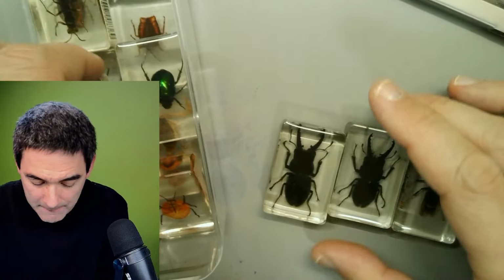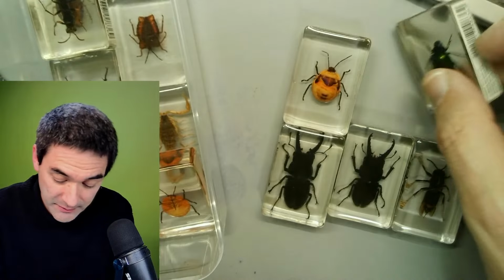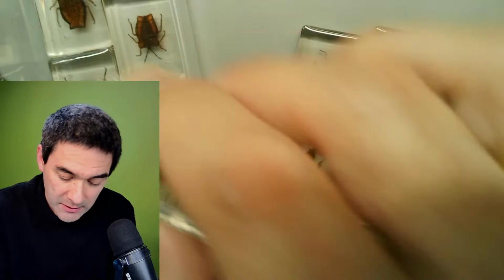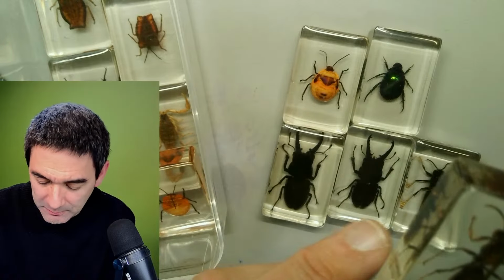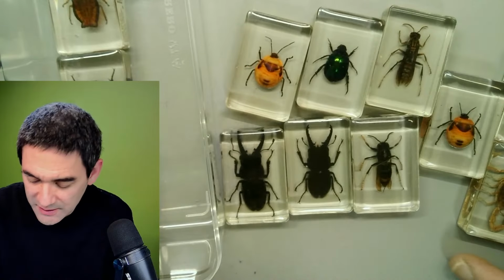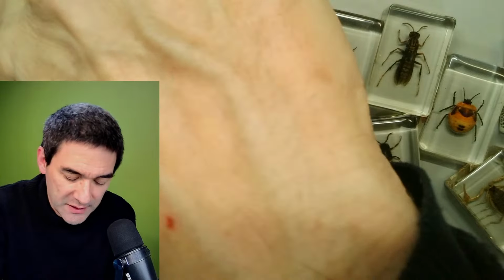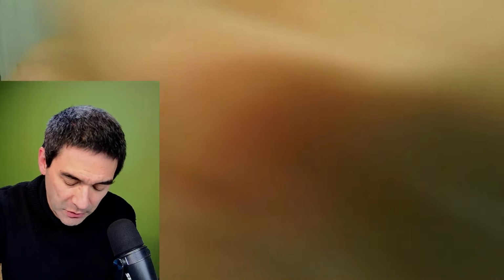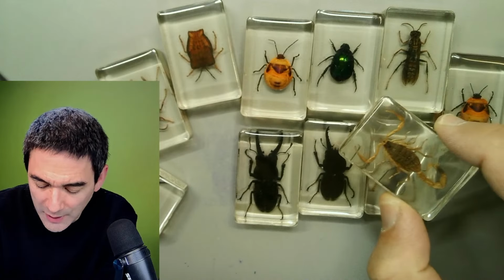And when we got them, I had to think the following: gee, not only do they look fascinating, but look at those, they're actually huge. Some of them are wasps and hornets, and there's also a description here on the side. Kind of nice looking. Under the stereo microscope, like a scorpion, we can look at the scorpion as well. It's also possible to look at them, however, because of the reflective surface, the image quality is not quite as nice.